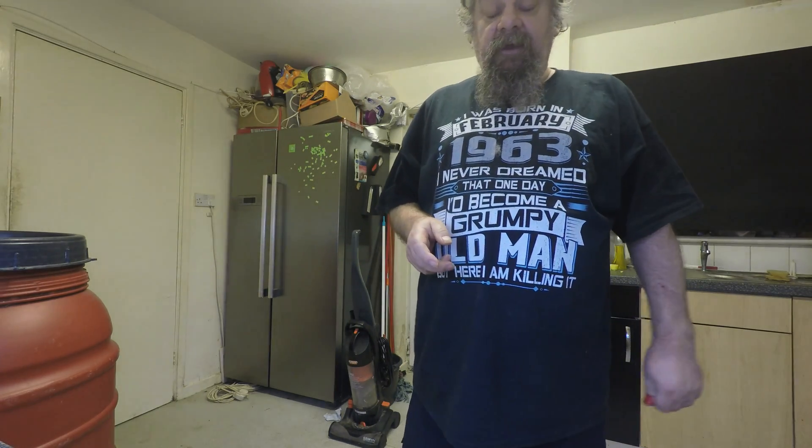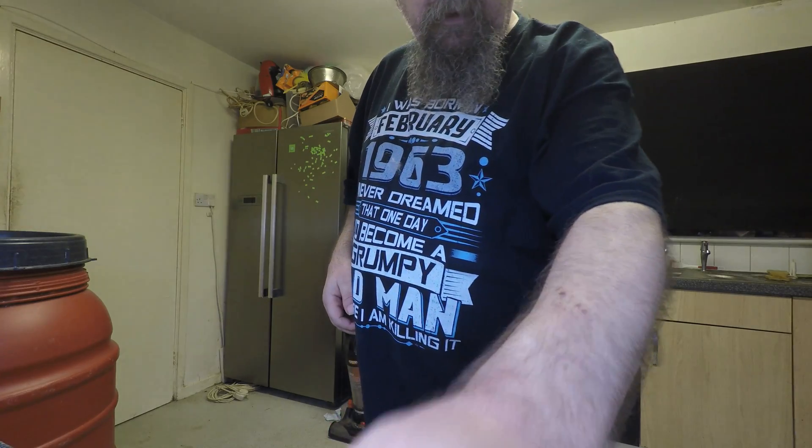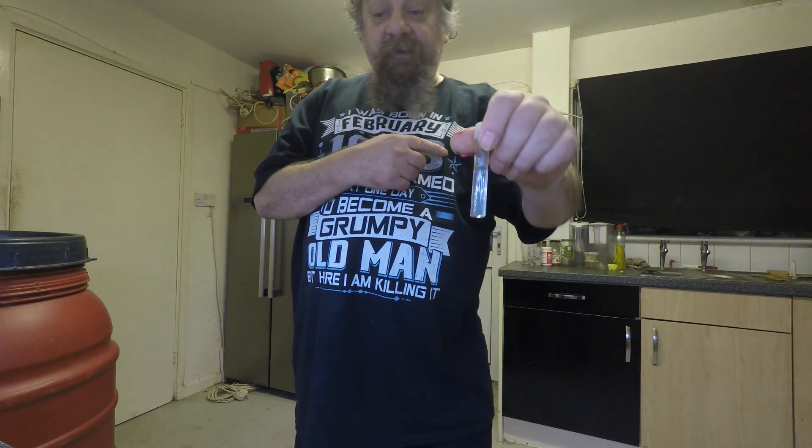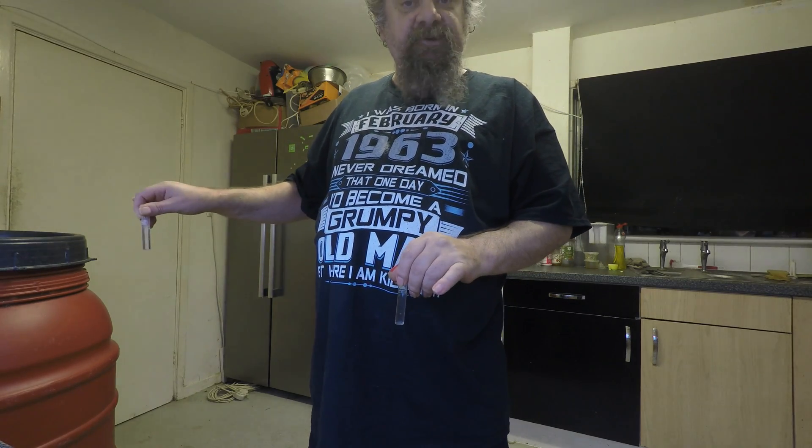Keep insisting that HMA cannot alter nitrates. This vial I've just taken from the tap. This vial I took from the barrel which is filled with HMA water.